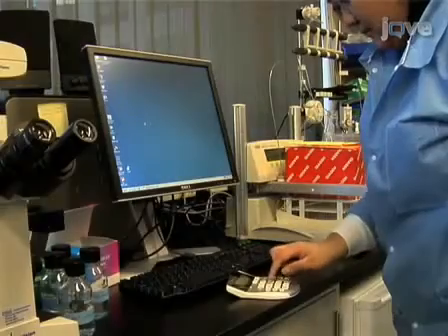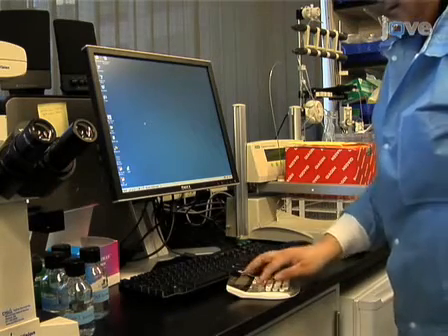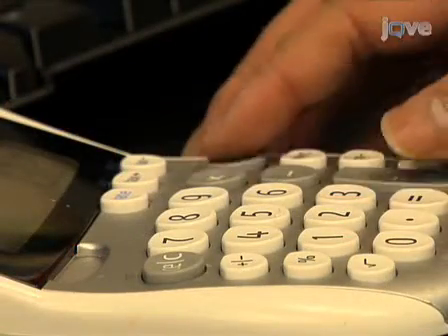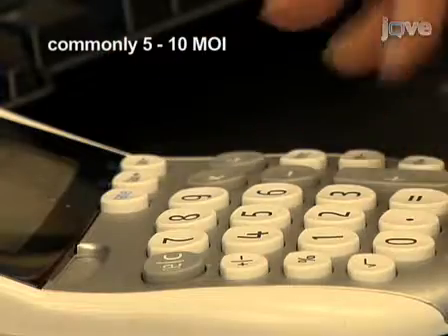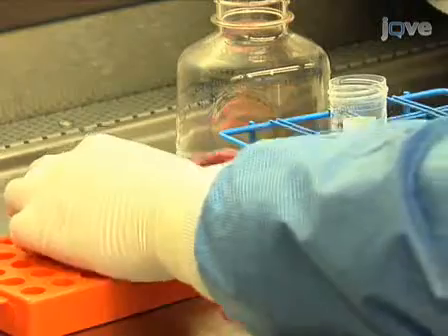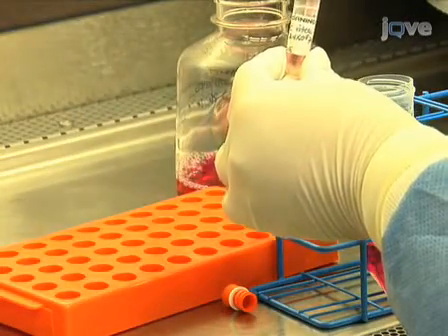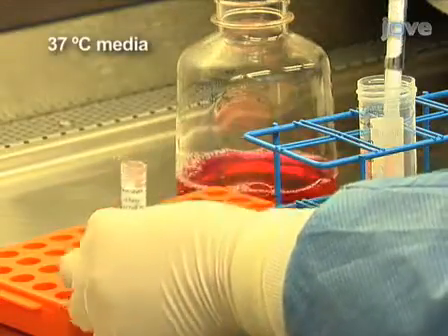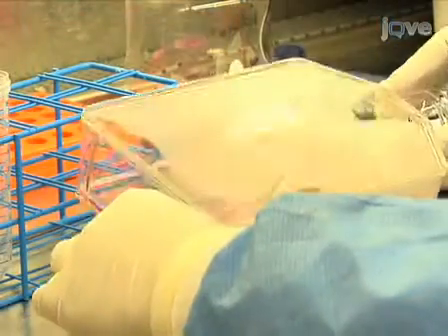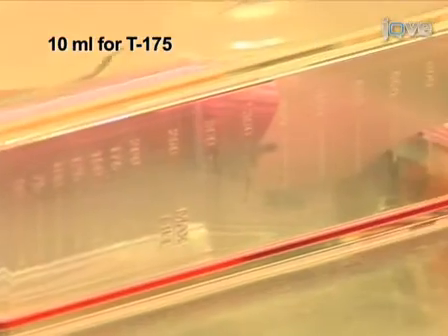To infect cells, first calculate the amount of viral particles needed to infect the monolayer at the desired multiplicity of infection, or MOI. Typically, a high MOI between 5 and 10 is used for infection time courses. Next, add the desired amount of sucrose purified virus or trypsinized crude virus to 37 degrees Celsius viral growth media and mix well. You should use enough media to just cover the bottom of the flask. 10 milliliters of media would be enough for a T175 flask.